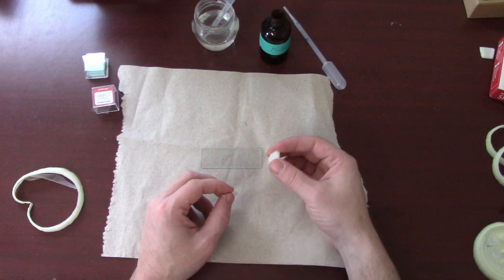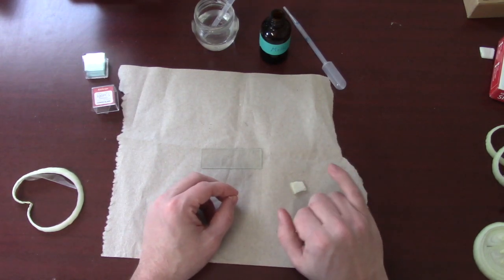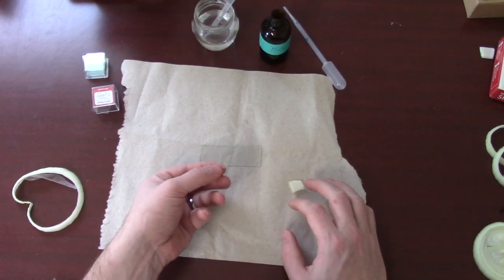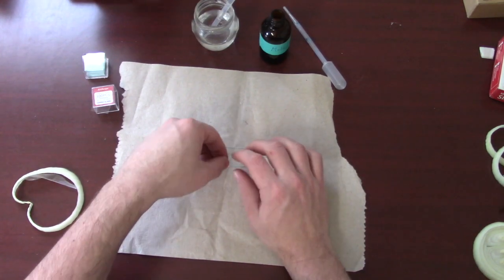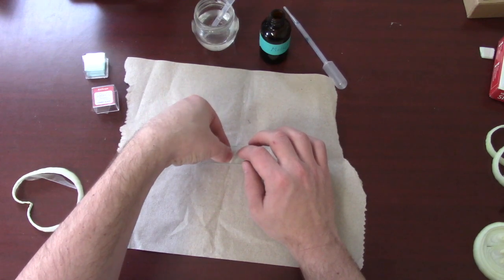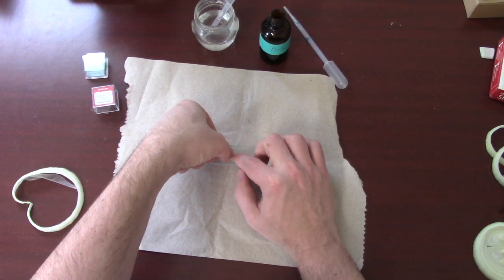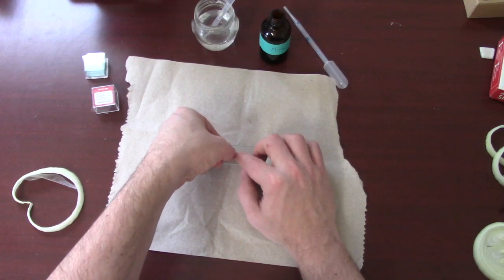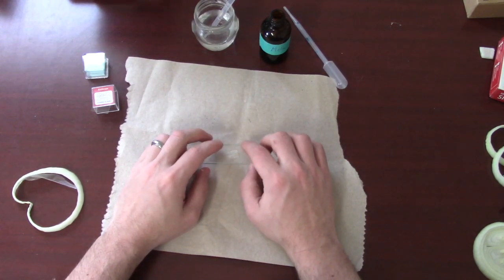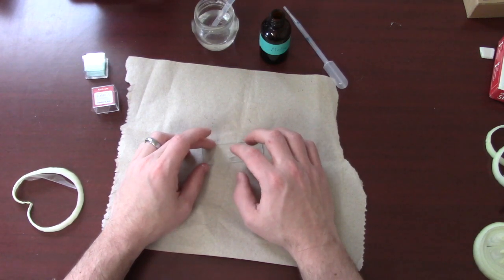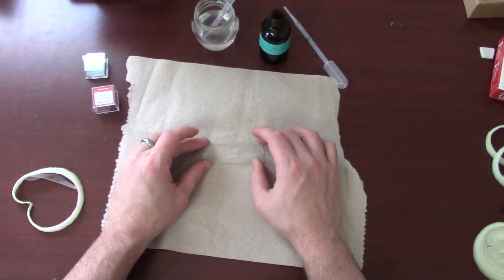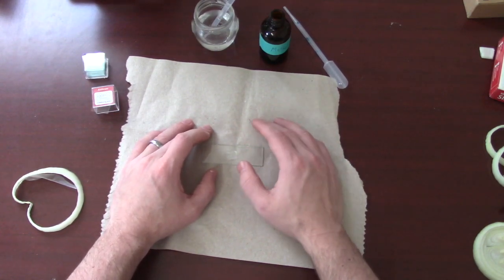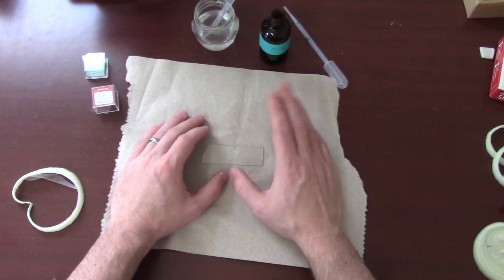Now, you don't necessarily need the whole piece, but you want something about as big as your pinky nail, just so it's nice and easy to see. So now that I've got my cells off, I'm going to set them on the microscope slide, putting them right about in the middle. If it's not perfectly in the middle, that's okay. And the one thing we do want to do is we want to try and get it in one single layer. These cells will want to try and crumple up on you, and if they get crumpled into a ball, it's not a big deal. Just start over.